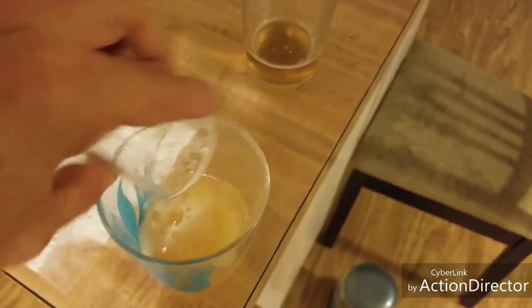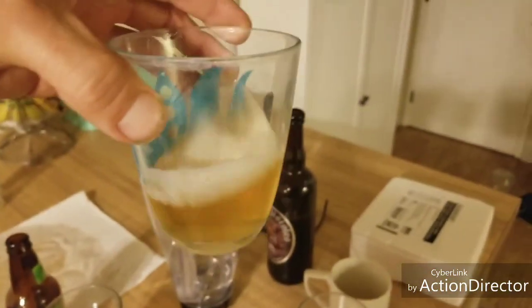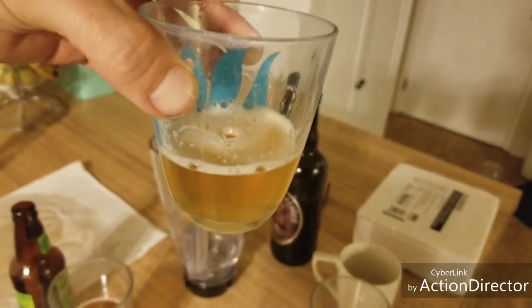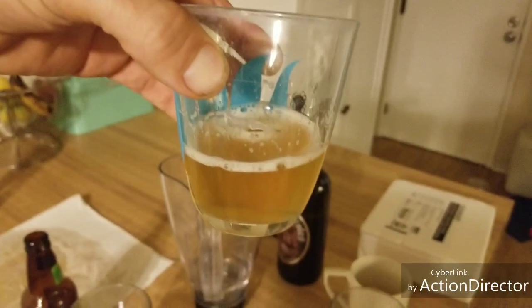And then I'm going to measure out 1 shot of water and throw that into here. I'm shooting for about 50%. I'm not expecting huge accuracy, but anything between 40 and 60 I'm going to say is success.